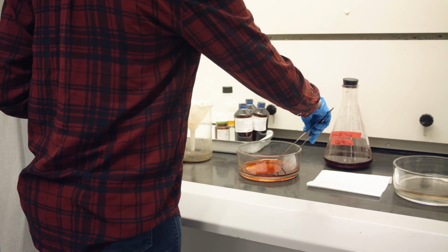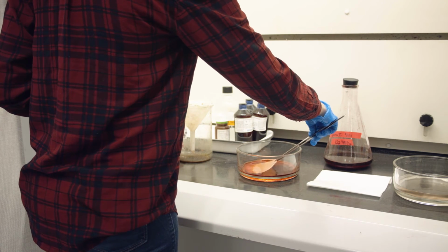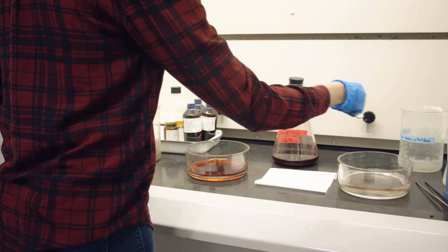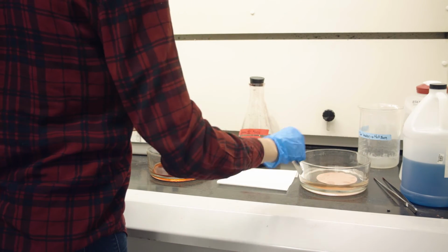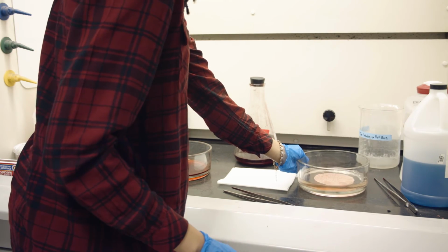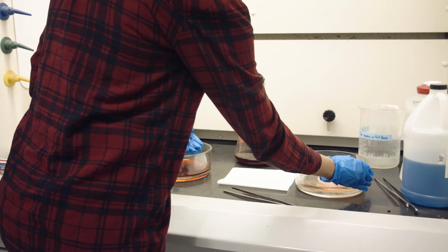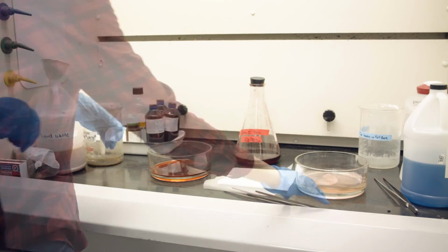After 5 minutes, using the provided forceps, carefully remove your filter paper from the Sudan 3 stain. Allow excess stain to drip off the filter paper back into the Sudan 3 stain tray before transferring the filter paper into the water wash tray located in the chemical hood. Gently move your filter paper in the water wash tray using the forceps to remove any remaining unbound stain.